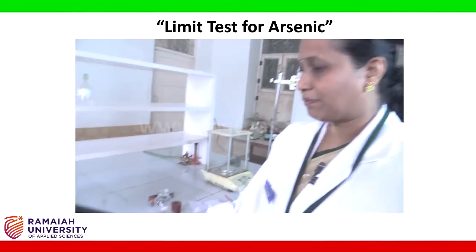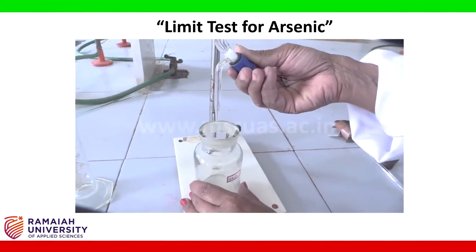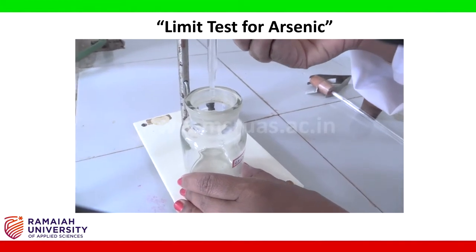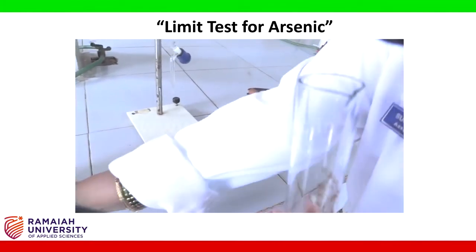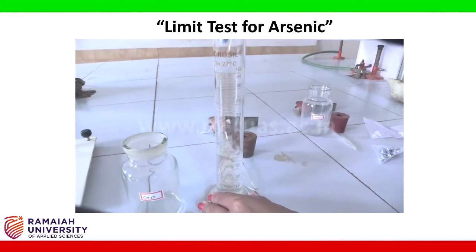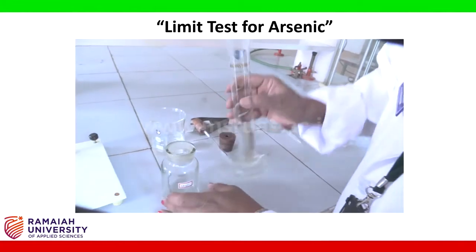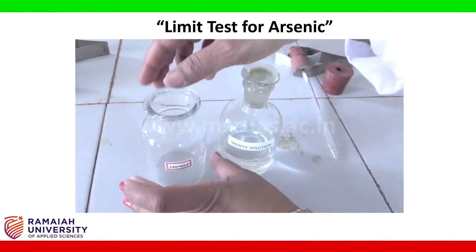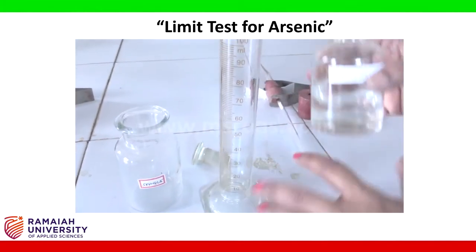After arranging the capillary tubes, next in the standard apparatus, take 1 ml of standard arsenic solution which contains 10 parts per million of arsenic. Then add 50 ml of distilled water. Next, in the sample apparatus, we will take 50 ml of sample solution.